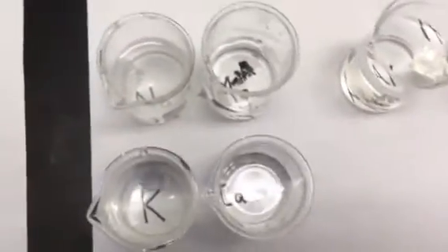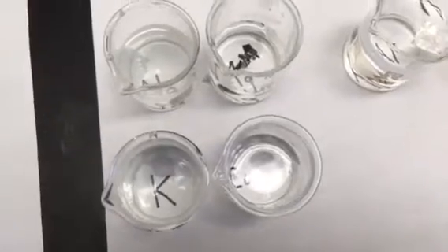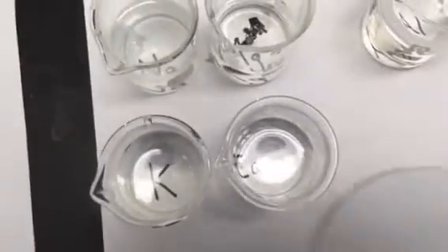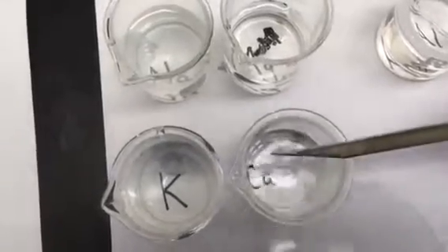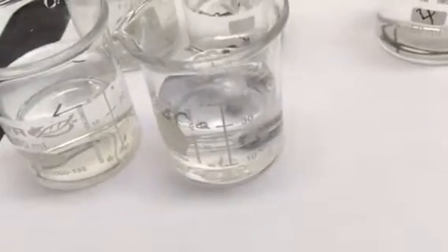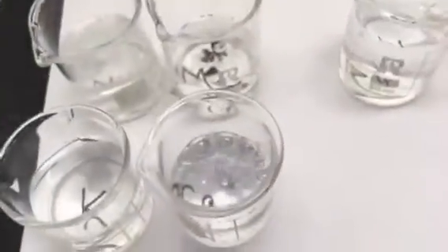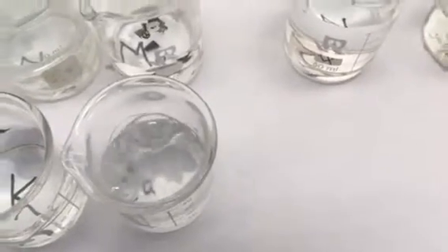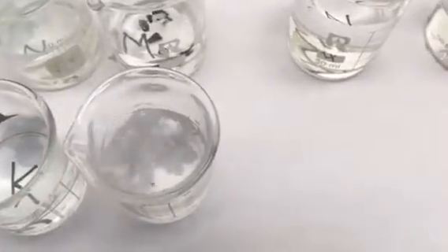Next, we're going to look at a piece of calcium. So we're going to take a piece of calcium, which is actually a metal, and we're going to scoop it into that beaker right there for you. And you can see that it is reacting, it's bubbling, and the piece of calcium is dissolving. This is making a gas, and the gas would be hydrogen. Not that that's terribly important.